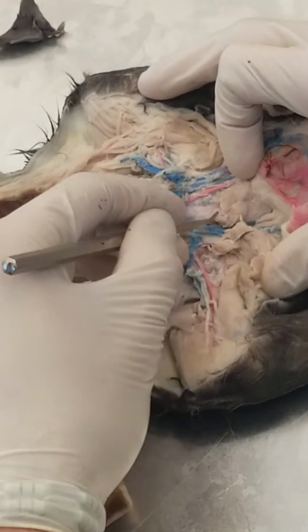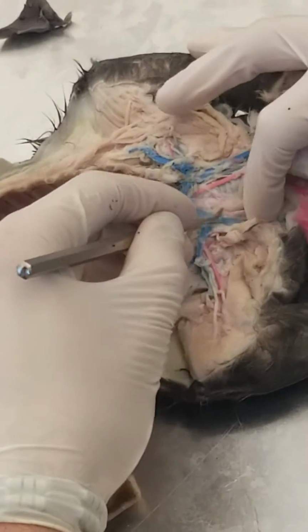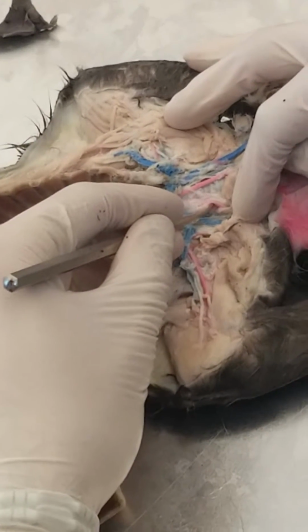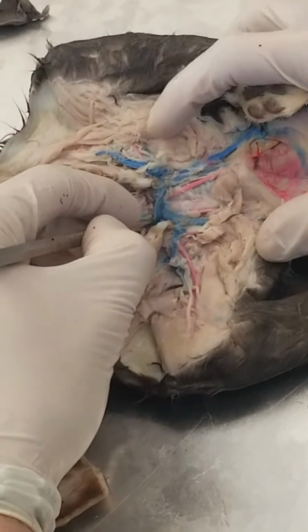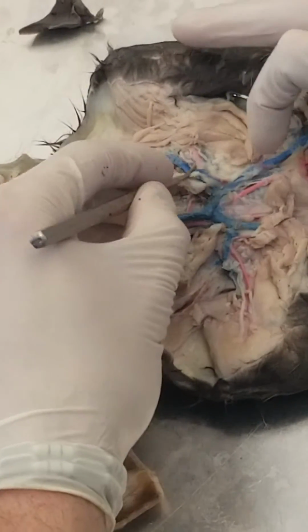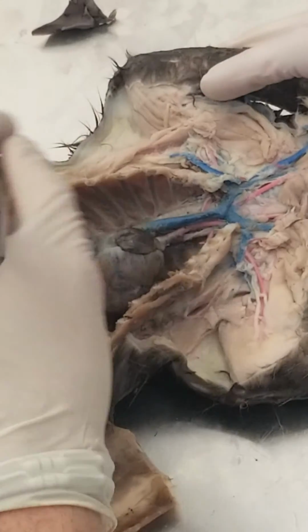So right there, see that? All you have to do is know where the right place is and dig, and you can find parts of your cat you're looking for. Everybody see that? See that thing I just dug up? That's your left common carotid, external common carotid. Okay, and then the right subclavian artery branches off there, goes over, becomes axillary here in this region, and becomes brachial farther in, but it hasn't been uncovered.